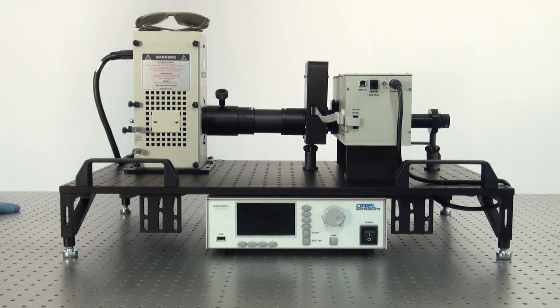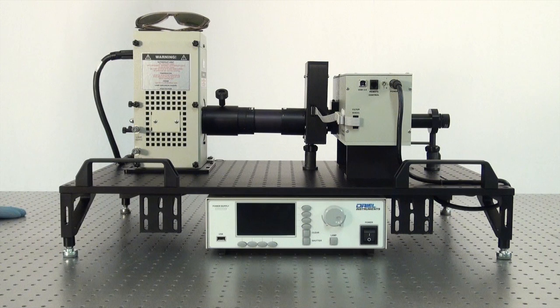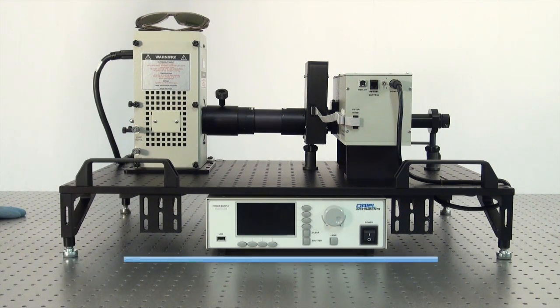Hi, I'm going to be showing you how to replace the lamp in your tunable light source. This particular light source is our 250Q version, so there's a 250 watt quartz lamp inside this light source.